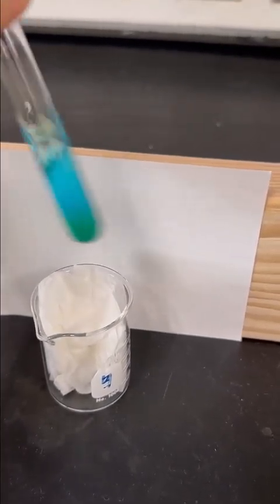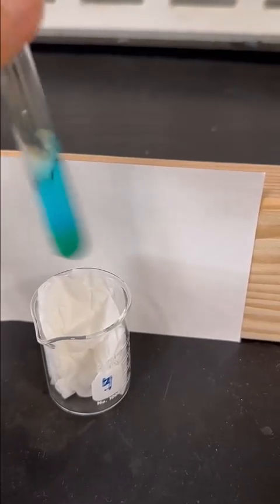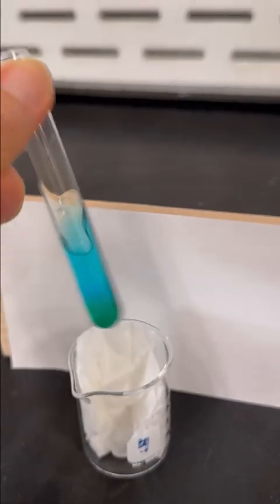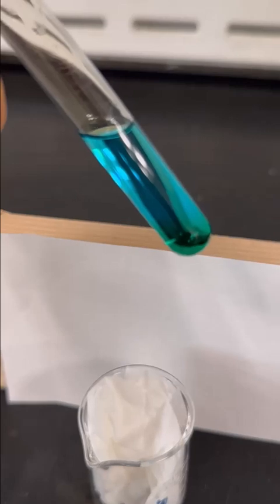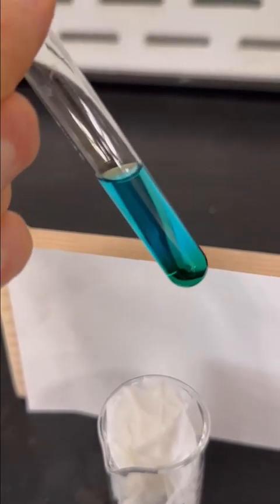And we'll mix that up here, and you can see this formation of the nice copper nitrate solution. We're going to dilute this now to 15 mils. Sorry, just trying to mix it just a little bit more there. All right, we're going to let that sit for a couple more minutes. And we will dilute this to 15 mils to start the next reaction. We'll also transfer it to a beaker.